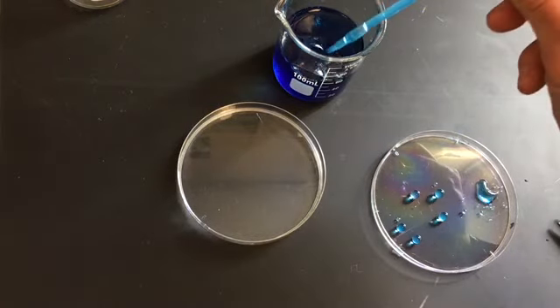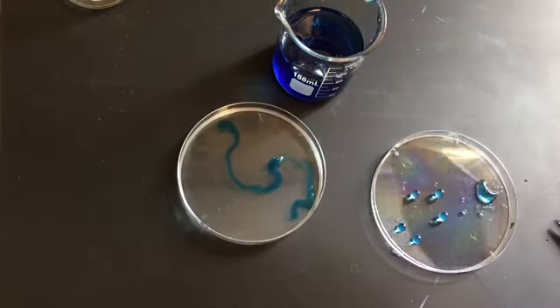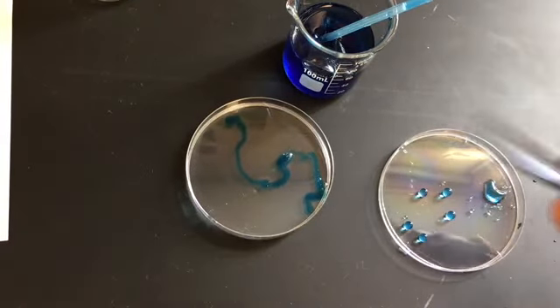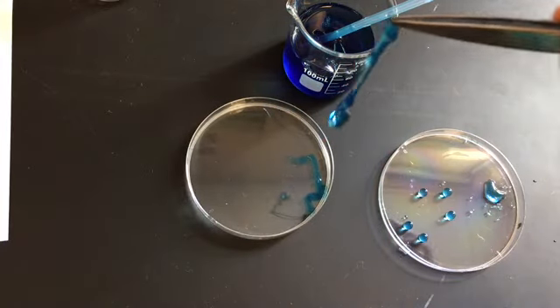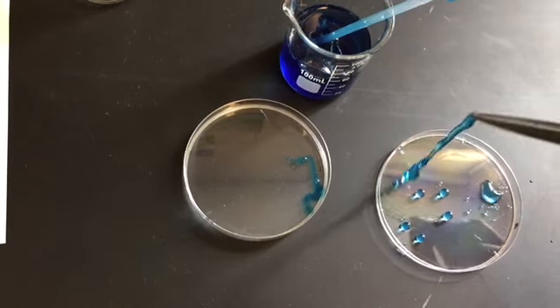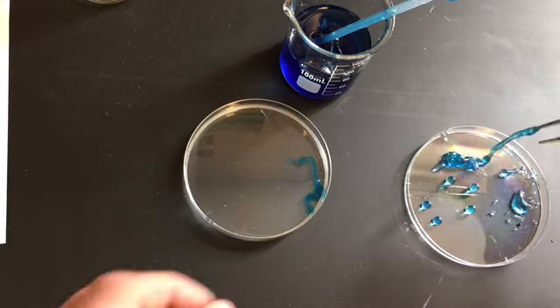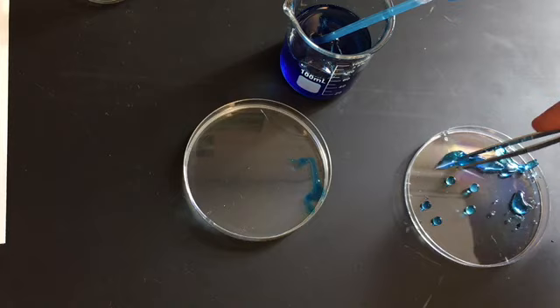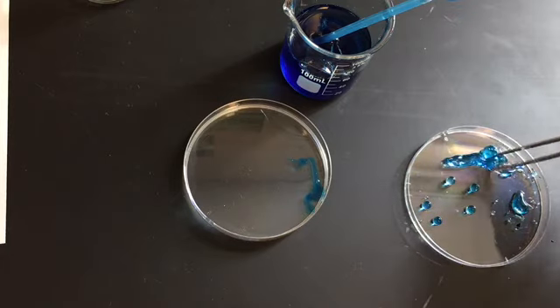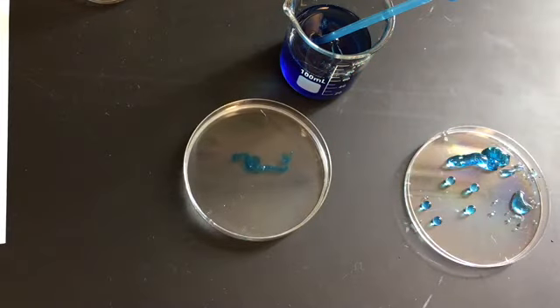So let's keep trying. Do a worm here. Now this is fun. Create a gummy worm here. Look at that. That is pretty neat. Lay it right there. So now it's all stayed together. Oops, it's not coming off my forceps there. It really wants to stick. That is pretty neat, huh? Let's see about this one. Let's leave that one sit a little bit. Let's see if it works better the longer I sit.